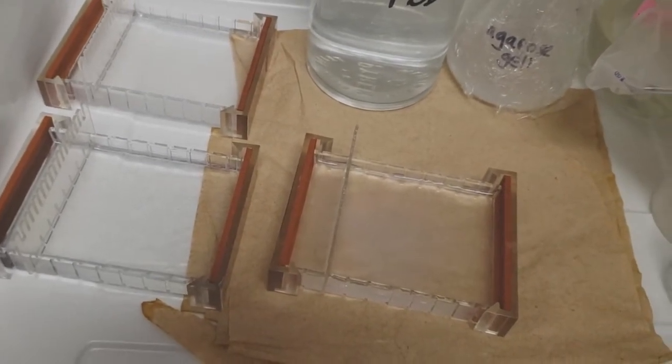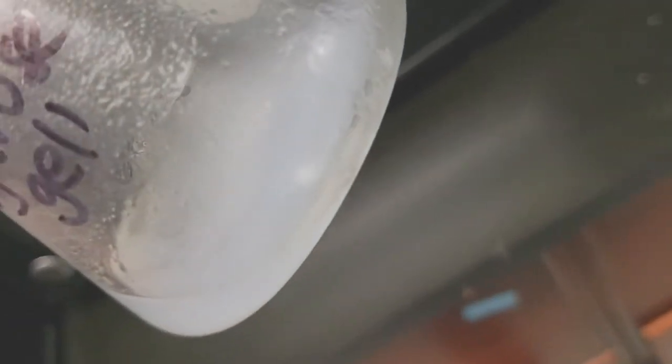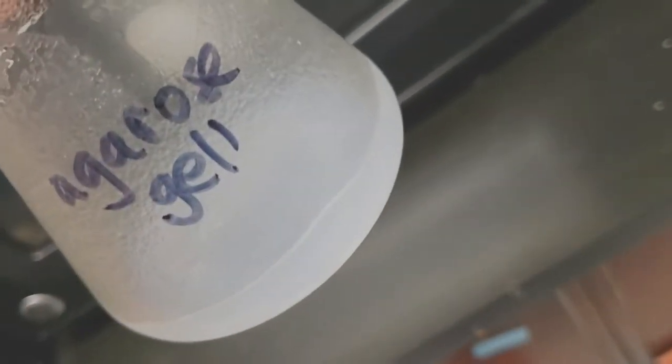Trying to run some gel electrophoresis runs. Check out this agarose gel. This actually heated for longer and did a better job at gelling. So it makes me think I just didn't heat it long enough, perhaps. I know gel is not spelled correctly.